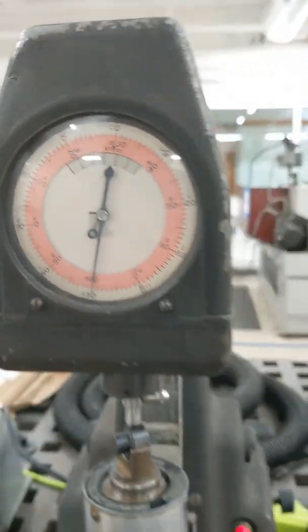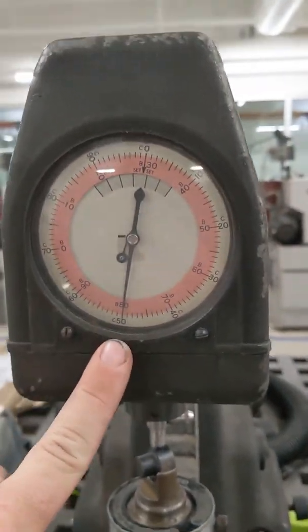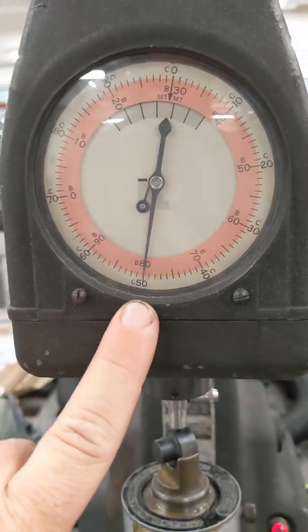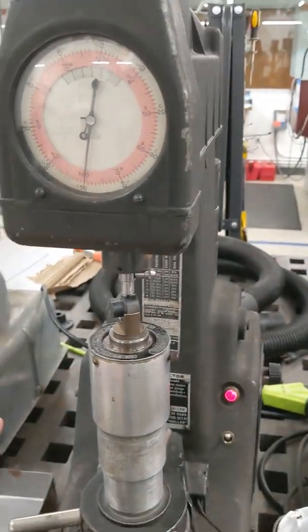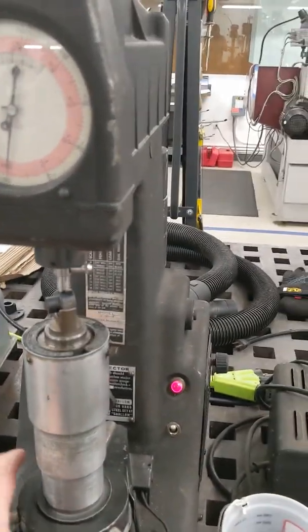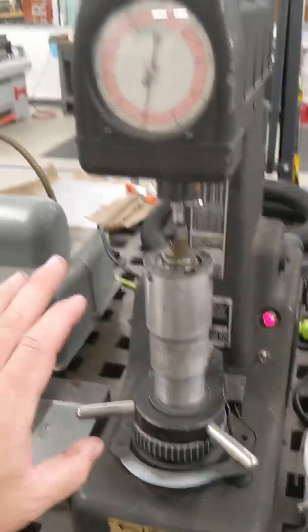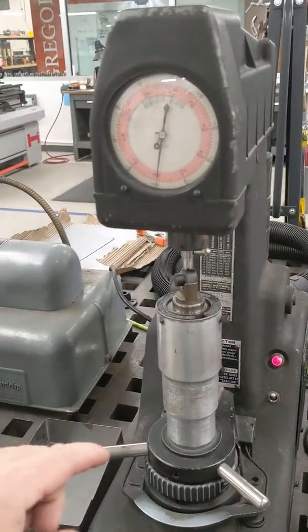When the needle comes around and stops, that's the hardness that you would record. It's good practice to test more than once to make sure you have uniform hardness around the part.